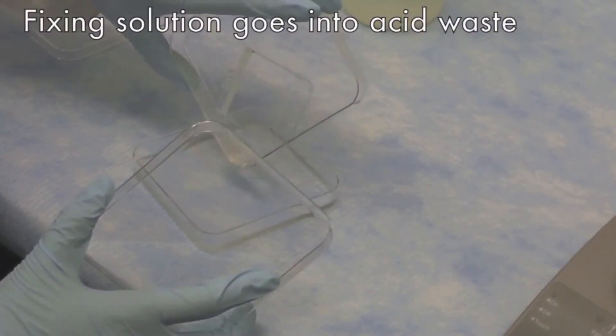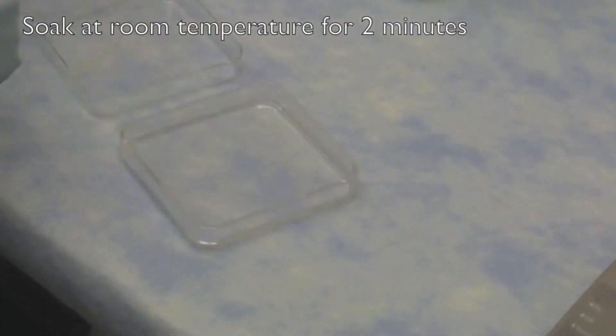Discard the fixing solution into the acid waste. Then add the washing solution and leave for 2 minutes at room temperature.